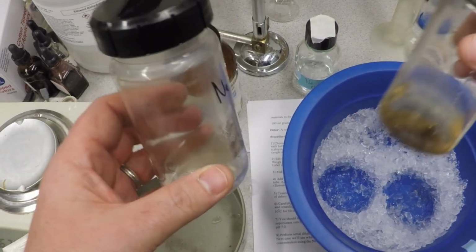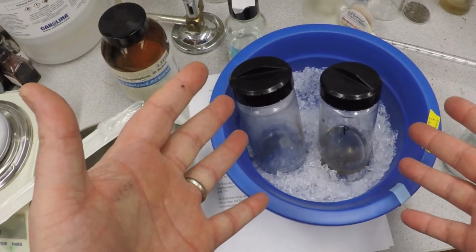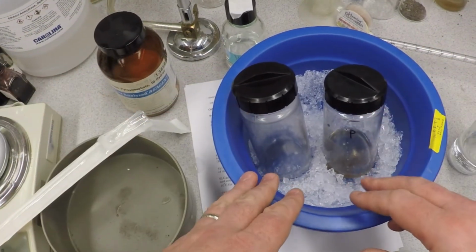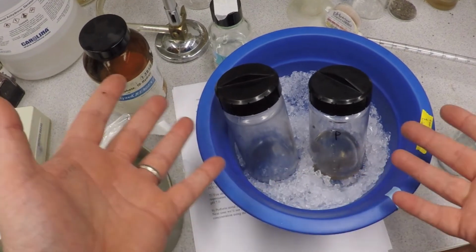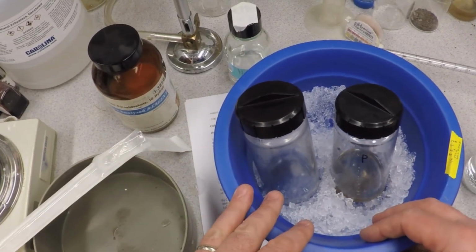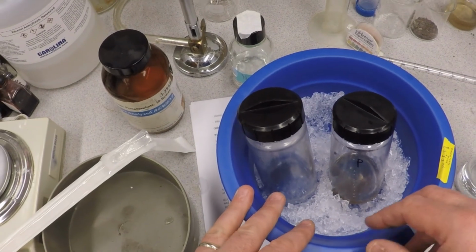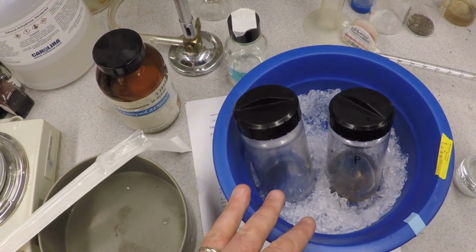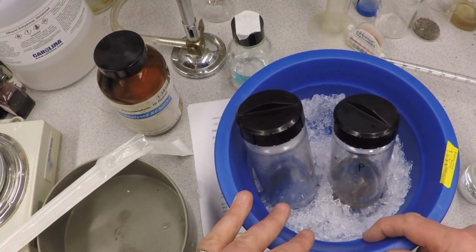Okay? So that's the setup for the lab, and that's basically the procedure that you're going to do for isolating bacteria from soil. And remember, it's a real experiment. We don't know which one is going to be different or if they're going to be different at all. Dang! So it's a real experiment, not hard to do, but it gives you some good practice in doing good lab hands-on stuff and thinking through the procedure, what you're going to do. Okay? All right, let's get to it.